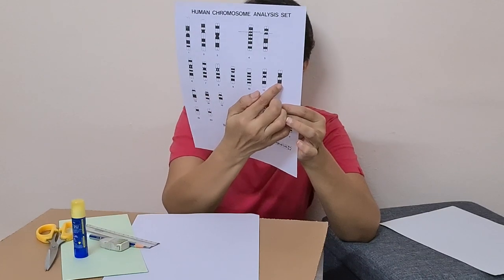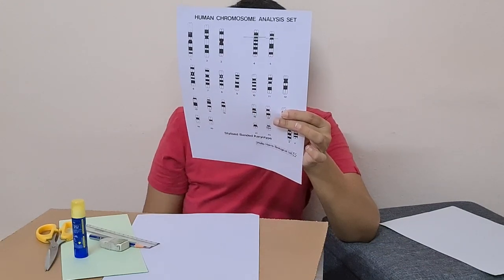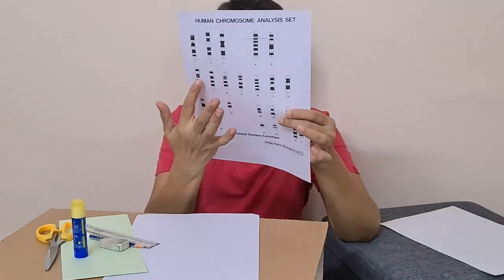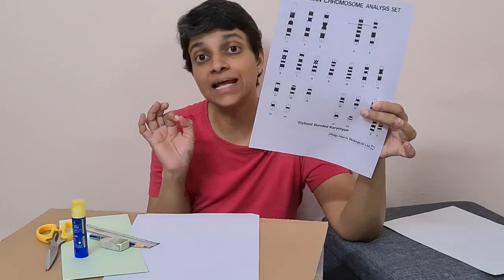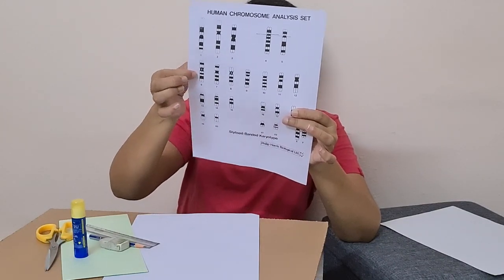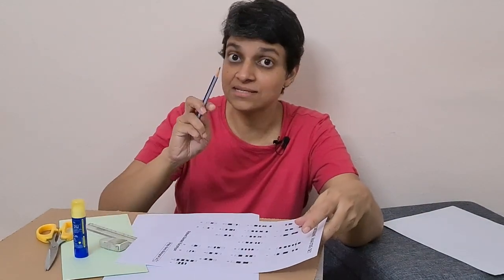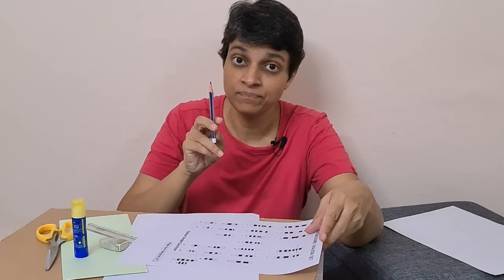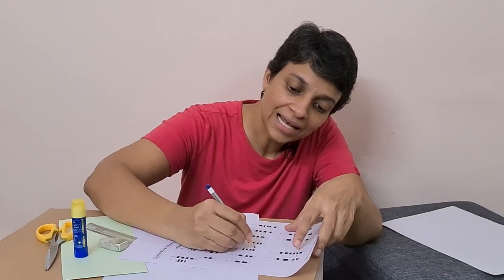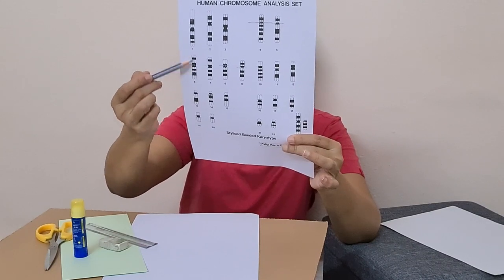Group C has chromosomes 6, 7, 8, 9, 10, 11, and 12 — seven pairs, or 14 chromosomes in group C. Group C chromosomes are medium submetacentric. Large submetacentric belong to B; medium submetacentric belong to C. If you put a line across the centromere, you can see that the P arm is shorter than the Q arm, making it submetacentric.